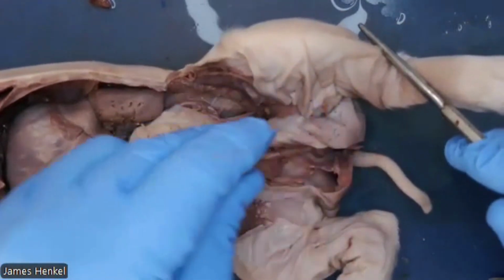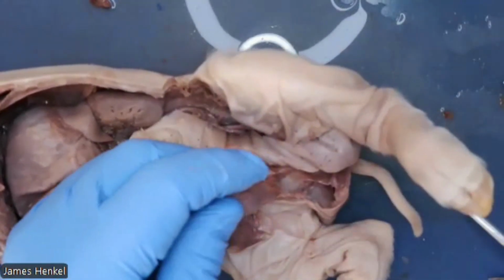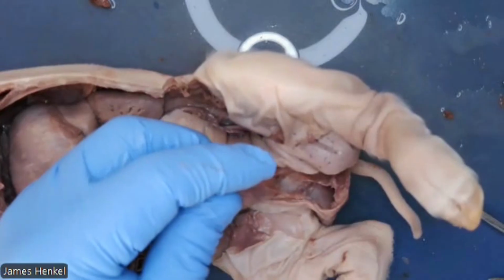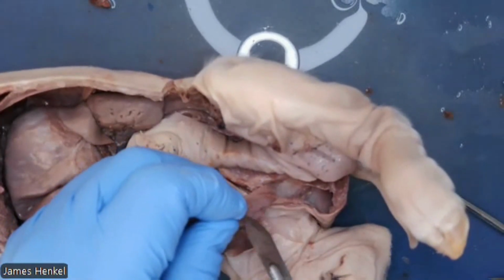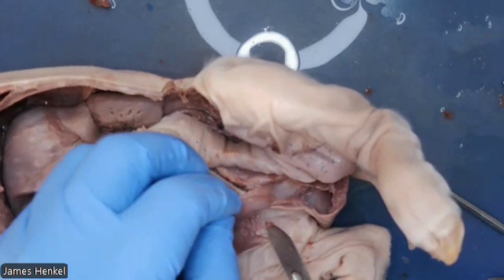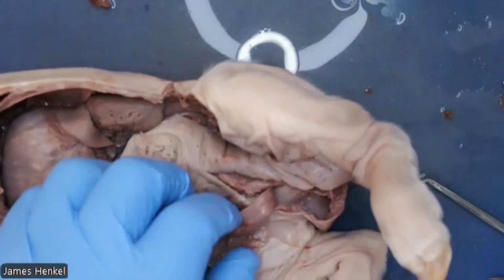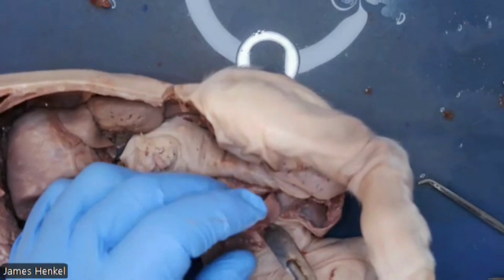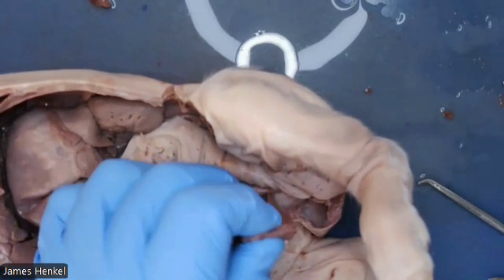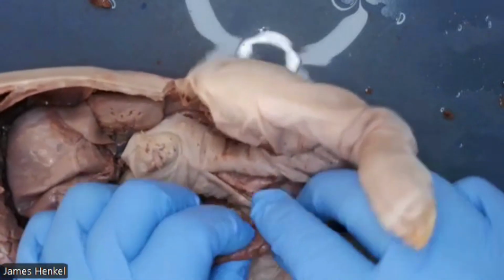And that's what the sac looks like, but we're going to have to cut into this. So we're going to carefully make sure that we're not cutting into the harder part there, but making a small incision of this sac without cutting what's underneath. And be careful of your fingers, of course, when you're using a scalpel that close. So I just nicked it, and then you can basically squeeze out what is in there and expose what looks like a small bean.